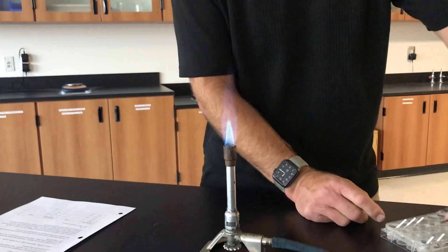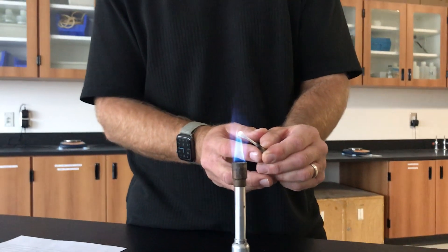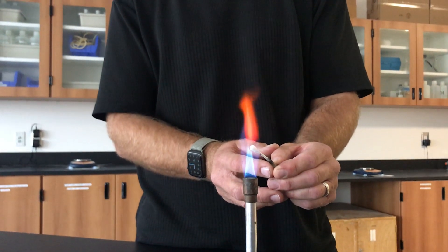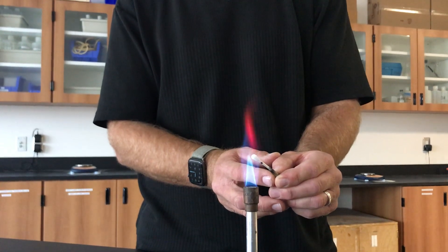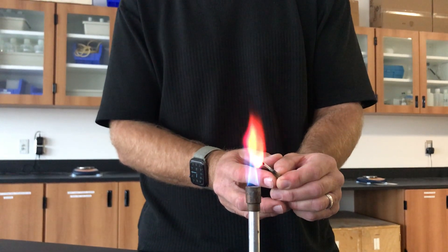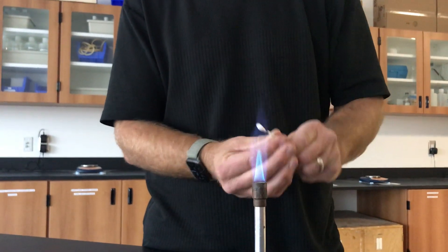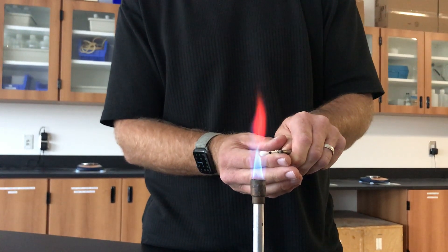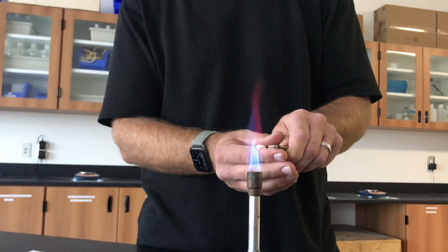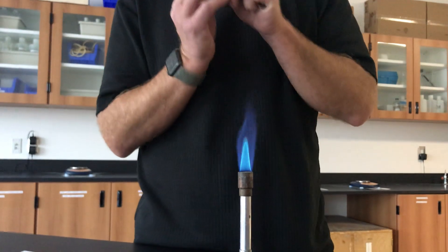Next we're going to do lithium. Here comes our lithium flame test — this one tends to be pretty vivid. There it is. There's our flame test color for lithium.